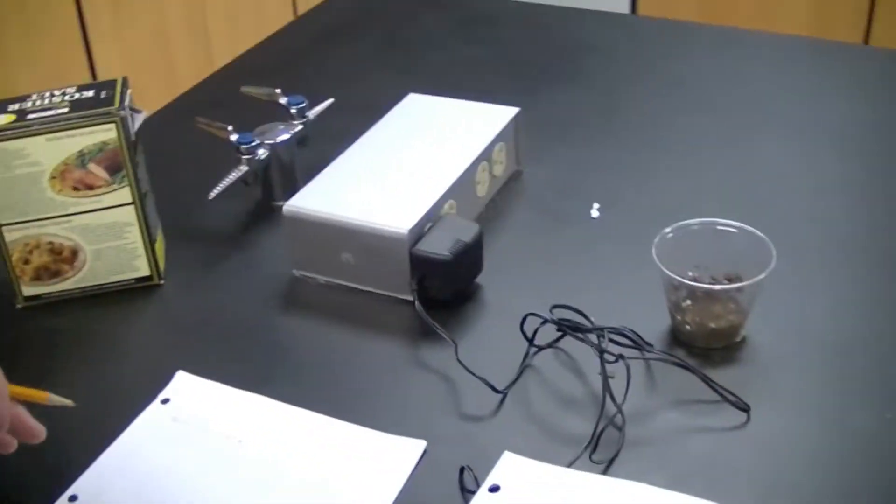So what we're going to do now is record our final mass, which in this case happens to be 4.66. So final mass, and that number again is 4.66 grams.